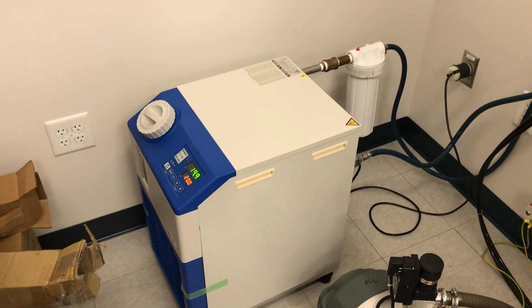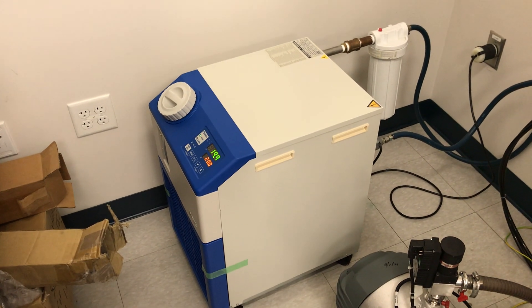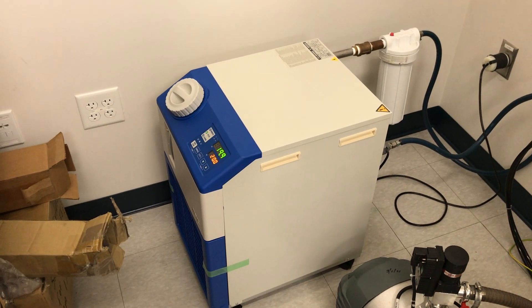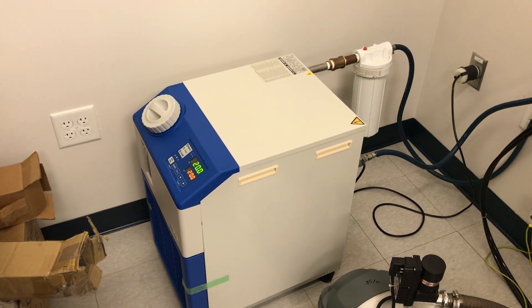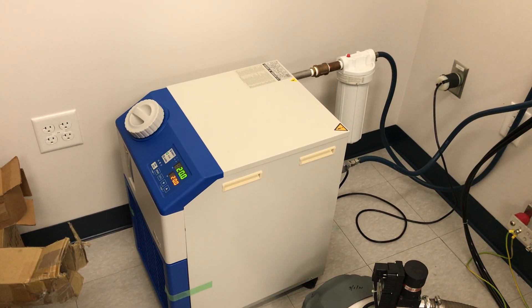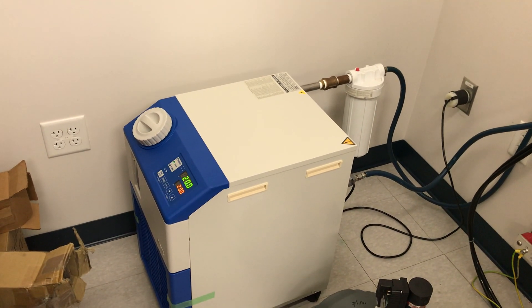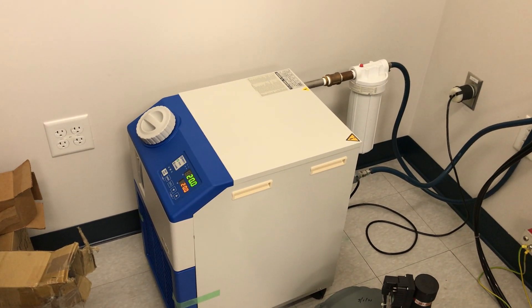Alright, hello everybody. I'm back to unfortunately crappy cell phone video here, but that's the only way I can really do this. I apologize for the noise here, but I'm going to try to talk over this as best I can. I wanted to do a short video about your water chiller for your electron microscope, and specifically how to make sure you get optimal performance out of it and how you can set it to allow your microscope to perform optimally.